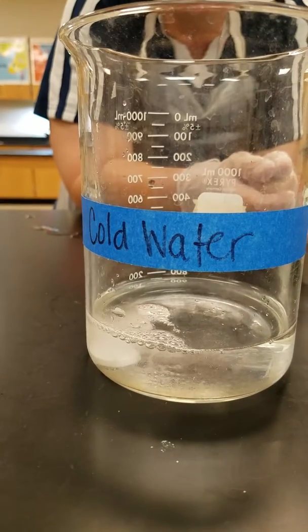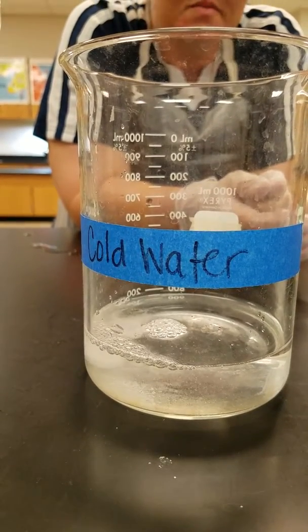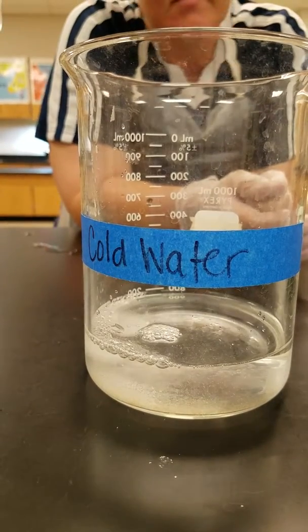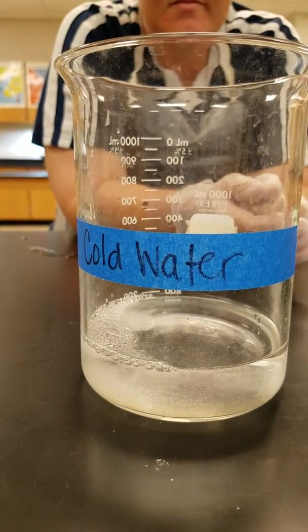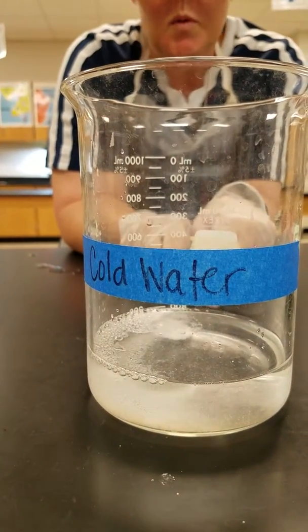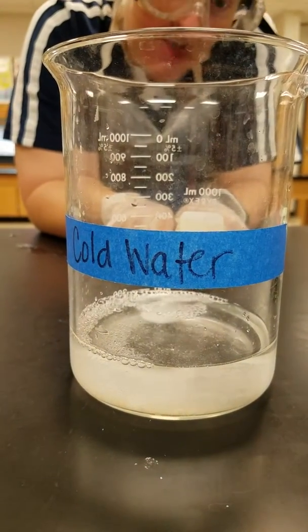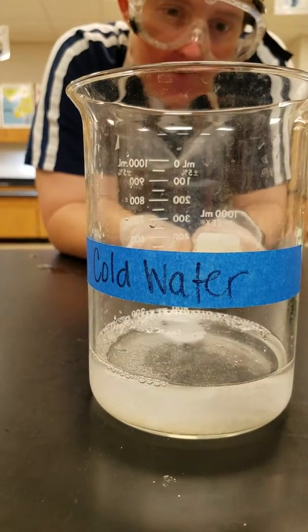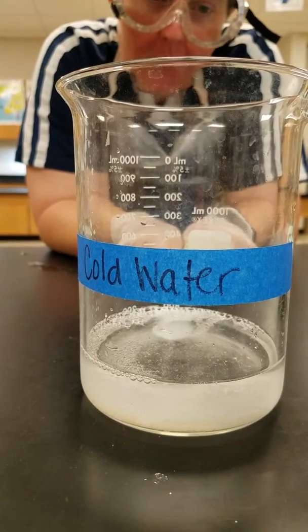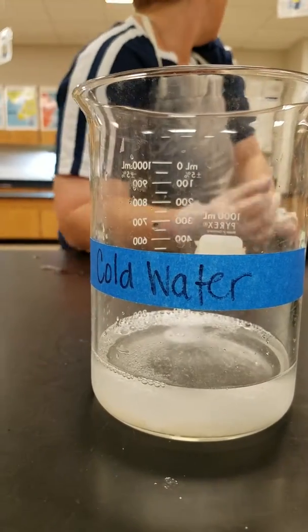Well, that's very slow. This might take a while. It's still recording. Alright, so sometimes the tab goes up a little bit, and that's because we're having air bubbles that are underneath it, pushing it up.